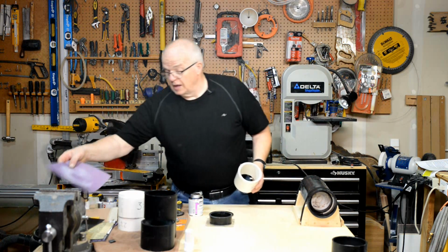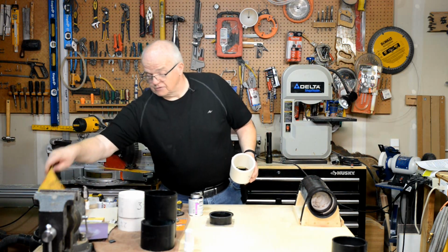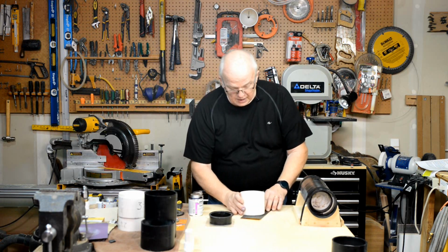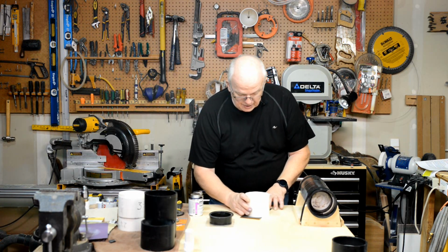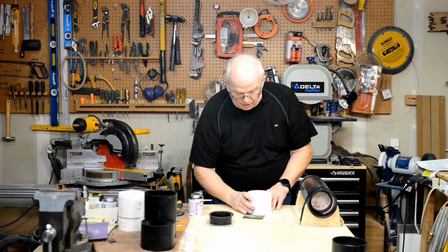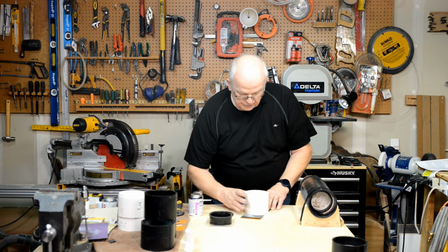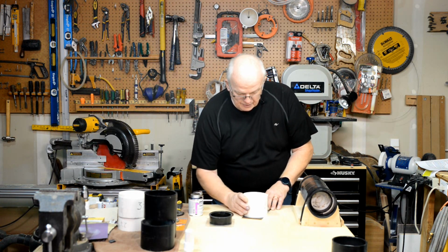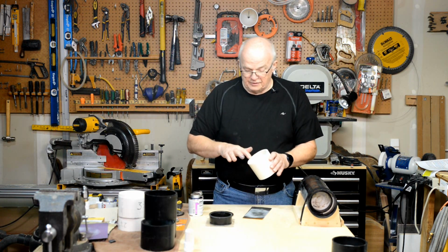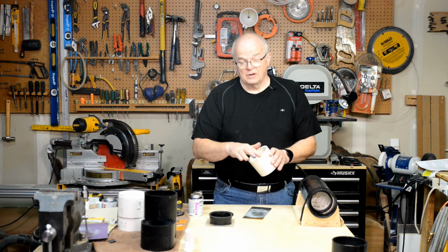But as a final step, I've got some 800 grit here. This is really fine, and I'll take that and I will move that around on there to kind of polish it up. Turn it sideways. And yes, now that is a nice flat surface.